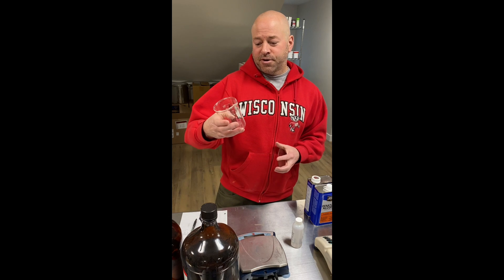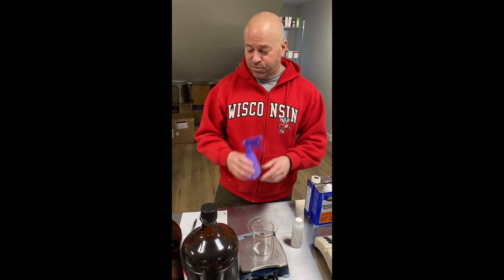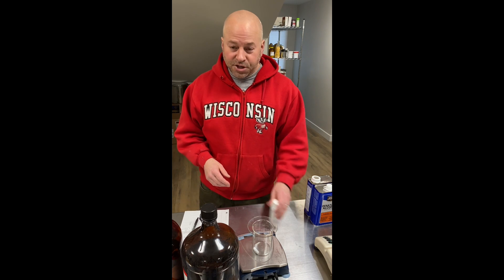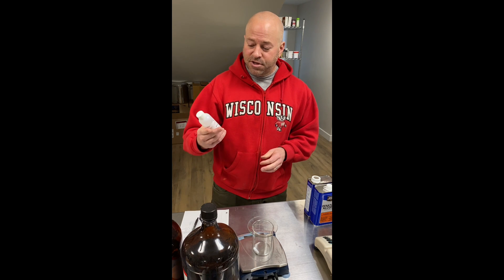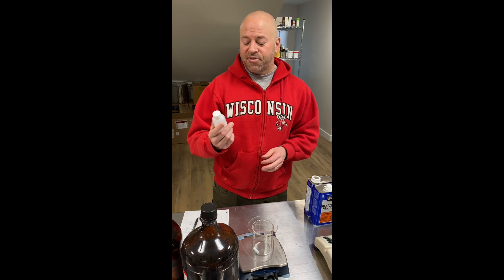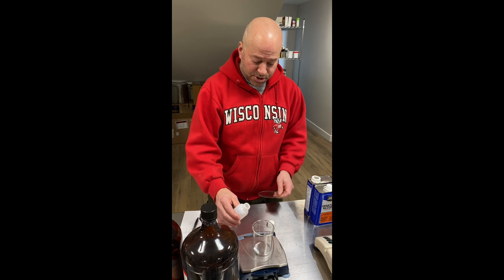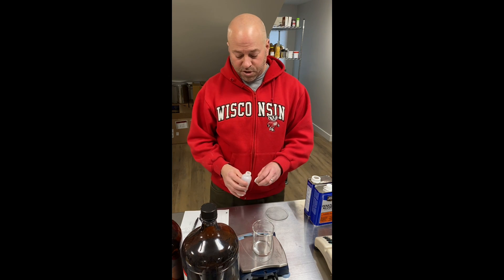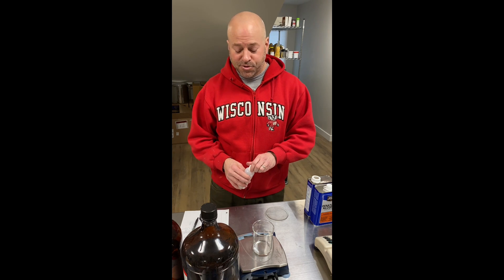For this batch I'm going to use a 250 milliliter beaker and make about 200 milliliters, because I'm going to put everything in this purple spray bottle I found around the house. First thing I want to do is add 20 grams of the PDMS, or dimethicone 500, that I picked up on the internet. We'll go ahead and zero the scale — we got a little more than 20, about 20.7 grams, that's okay.